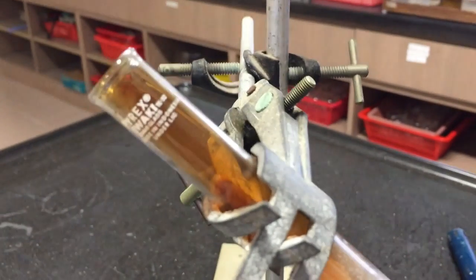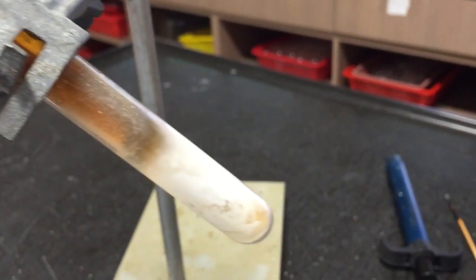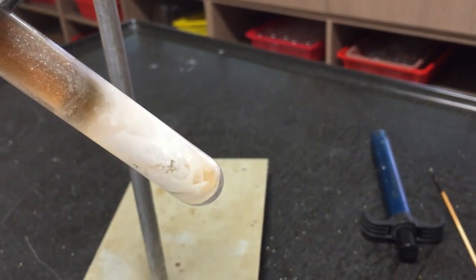Once you are done heating, turn off the flame. Let the test tube cool and make further observations of the solid that remains within the test tube.